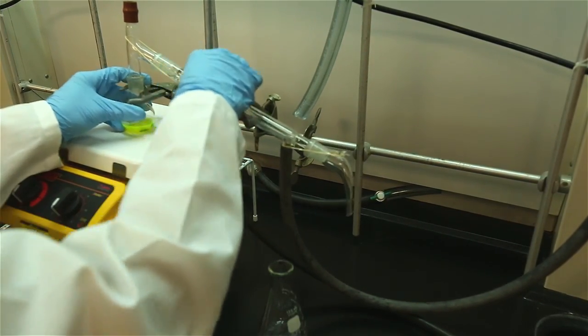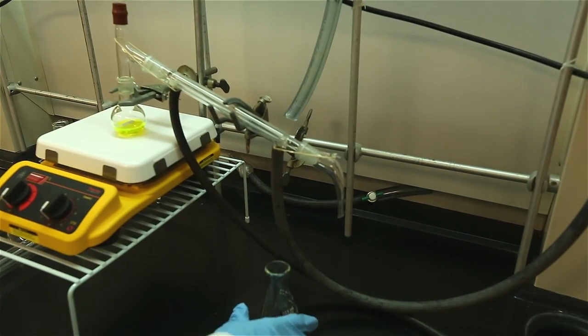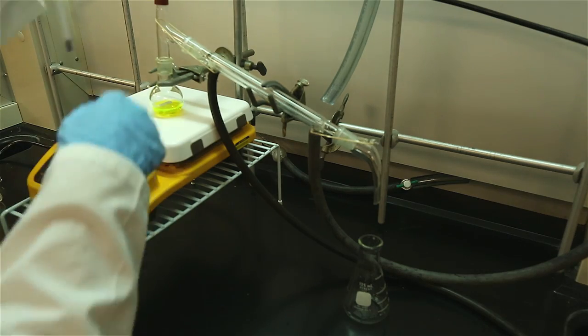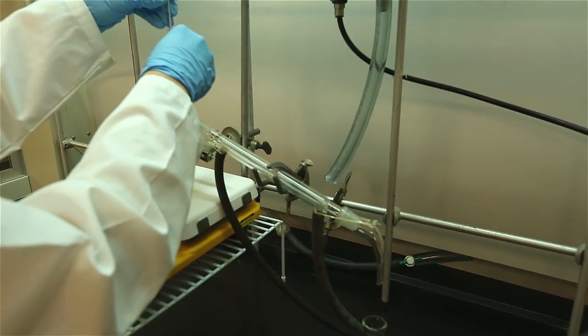Use the elastic band to stabilize the apparatus. Make it a habit of as soon as you connect the glass joints to use an elastic band to connect the pieces and don't just rely on friction to hold the pieces together.